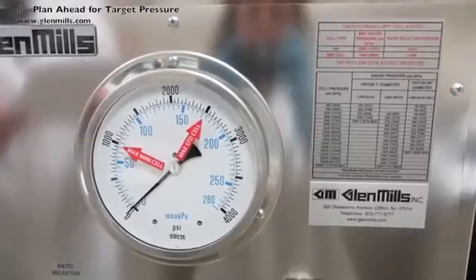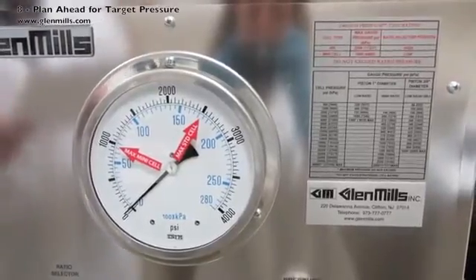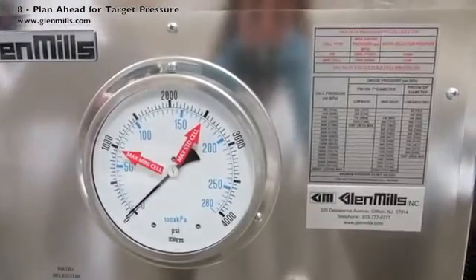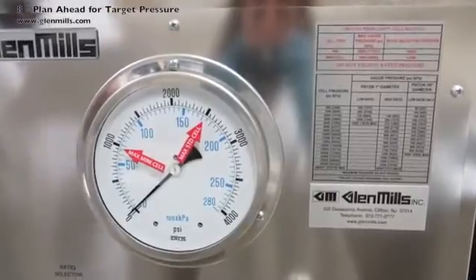A target operating pressure will be established from prior knowledge, the literature, trial and error, or other suggestions. For bacteria, we generally set the machine to the maximum 1500 pressure setting and release the pressure valve, keeping it above 1000.